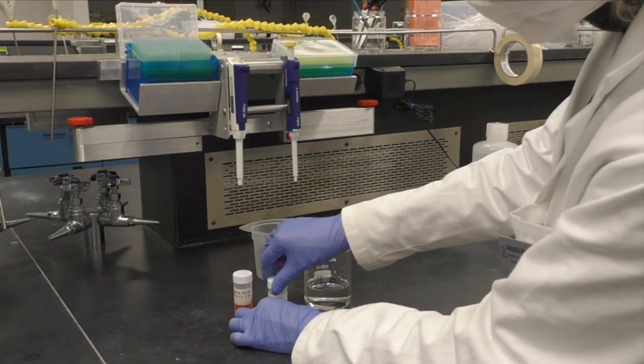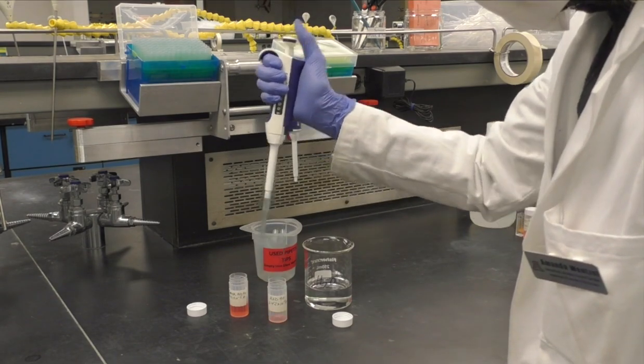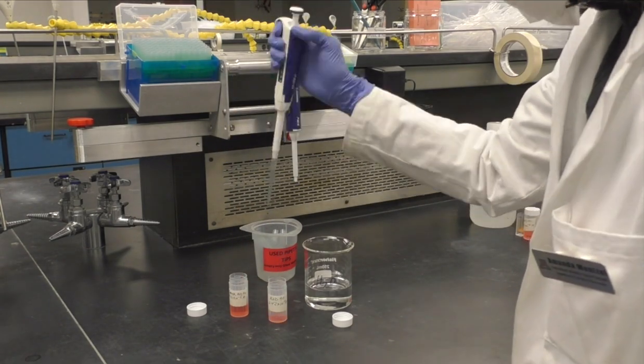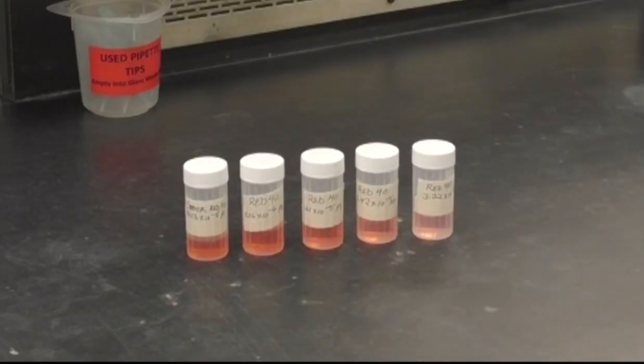Next, create your solutions using the appropriate micropipette. Be sure to use a fresh tip every time you change from your stock solution to your solvent. Here is our finished set of solutions. As you can see, each one is slightly different.